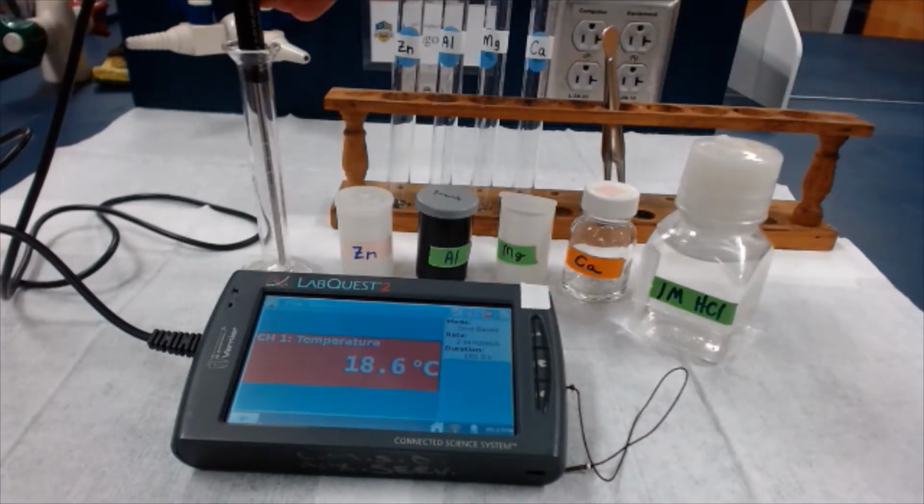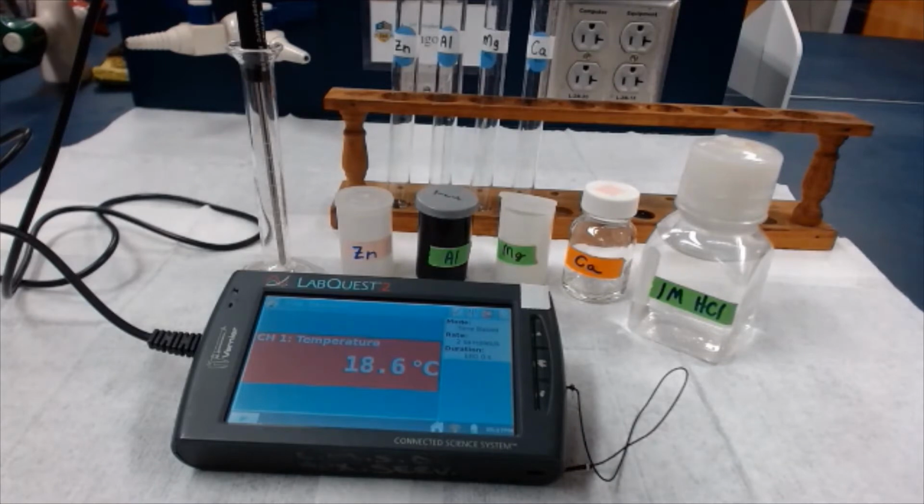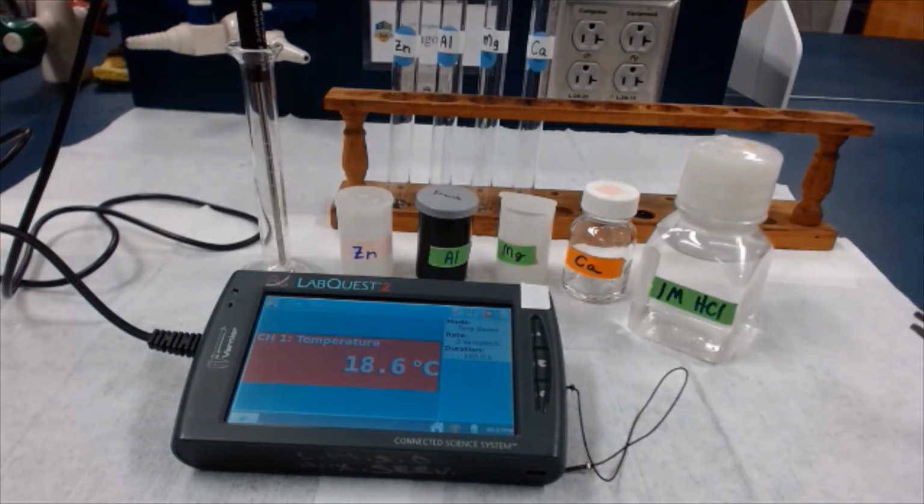We need a 10 milliliter graduated cylinder, some forceps to handle the metals with. We need 4 large test tubes. That's what we're going to do our reactions in, and you can see that they're labeled with the identity of the elements that are going to be reacted in them. We want a digital thermometer because part of our reaction, besides just watching the reaction between our metals and acid, we're going to actually monitor the reaction with temperature, see if there's a temperature change. And finally, somewhere around here, I have a plastic pipette that I can use to adjust the volume of my acid. Okay, well, looks like we're ready to go.